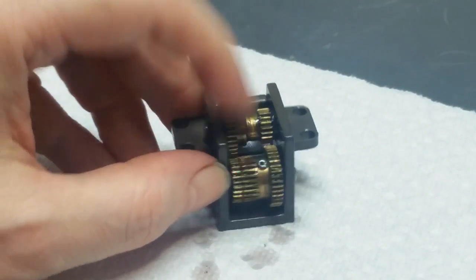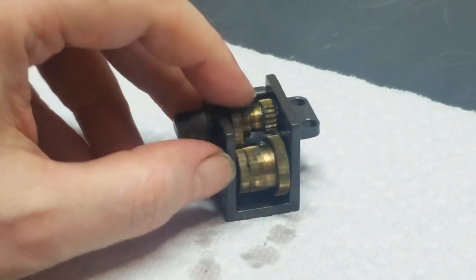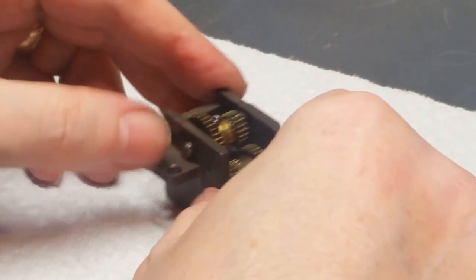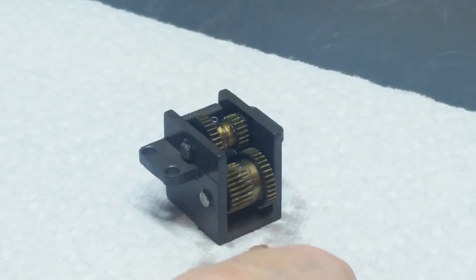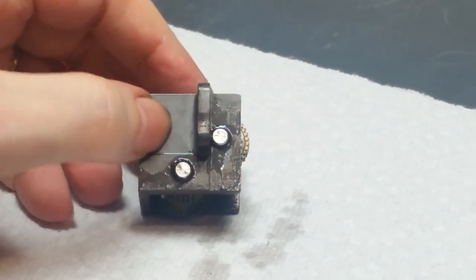And that just freed up the gearing a lot. It's not a long-term fix. It's not the real way to fix it, but it's way easier to turn now. But the problem is sometimes getting these pins to push out. Sometimes you can just push them. Let's just try that. And if it turns out they're too stubborn to move, then we have a couple options.